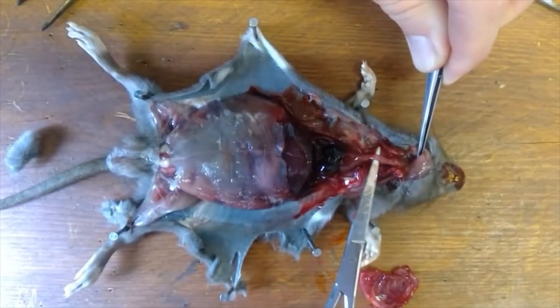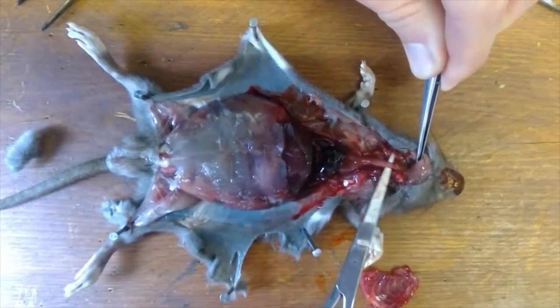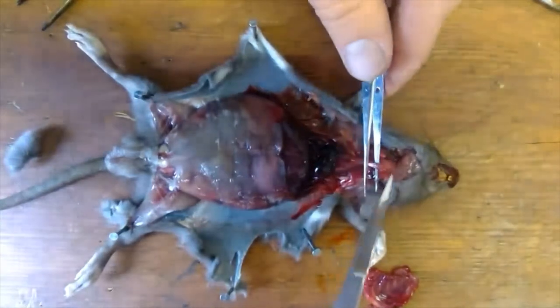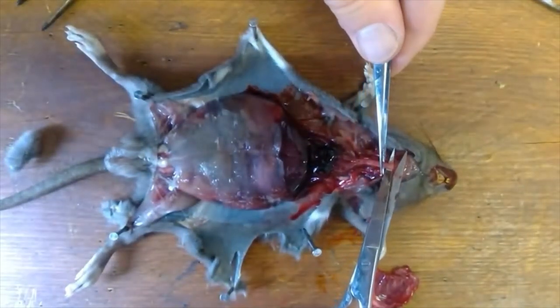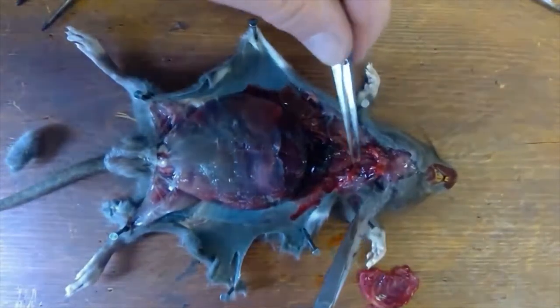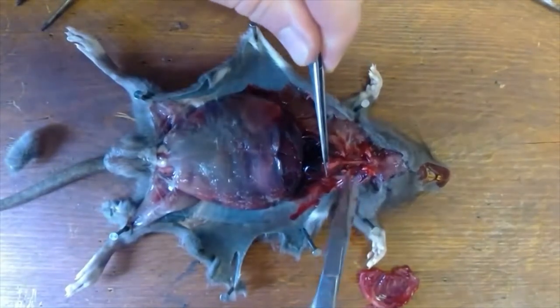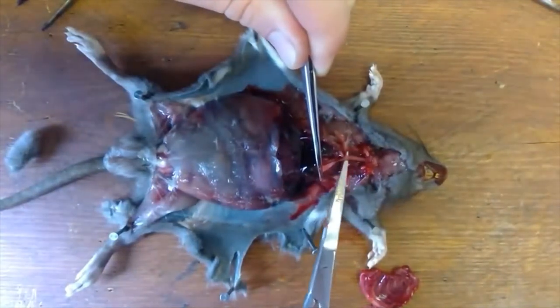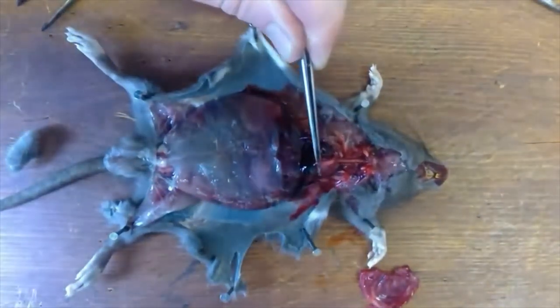You can see the trachea is ribbed — it has cartilaginous rings to help it stay open when it's under pressure more negative than the atmosphere. We can cut that and use it now. It's a bit elastic. This tube here is the trachea, and there's the oesophagus behind it. What's been quite nice is we've managed to separate the two.